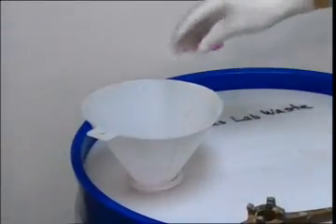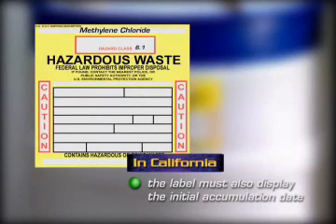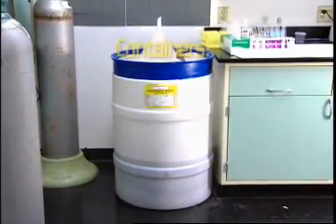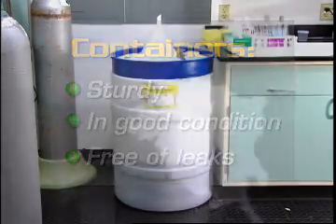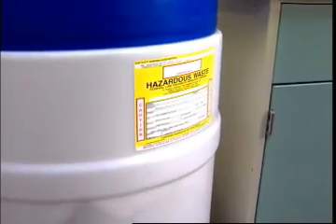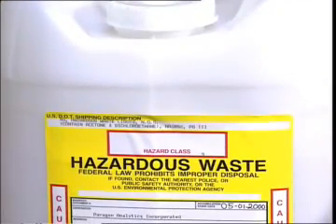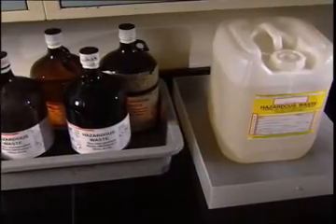Each satellite accumulation container must be clearly labeled with the words hazardous waste and/or a description of the waste inside. Containers used to accumulate hazardous waste must be sturdy, in good condition, and free of leaks. If a container is ever observed to be leaking or damaged, the contents must be transferred into a leak-tight container immediately. The container itself must be constructed of a material that is compatible with the wastes inside. Original containers are often used, as are containers made from chemically resistant plastics.